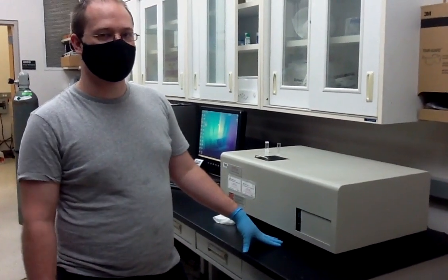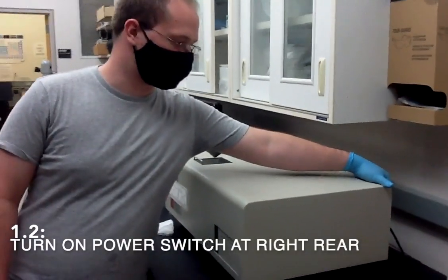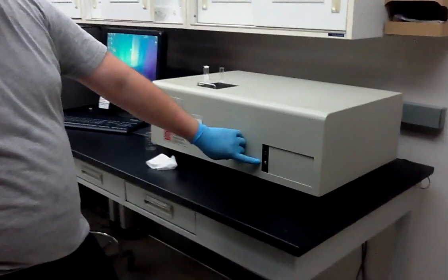Upon approaching the instrument, check to see if the power light is on. If it is not, then you need to begin by turning on the power by flipping the switch that is in the rear. The power indicator in the front should then turn green.